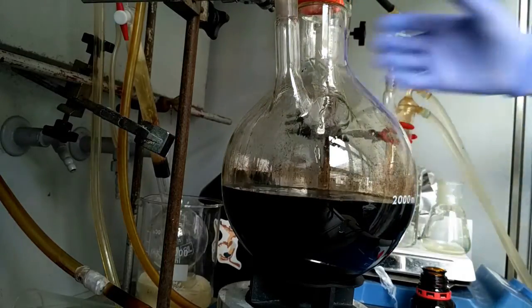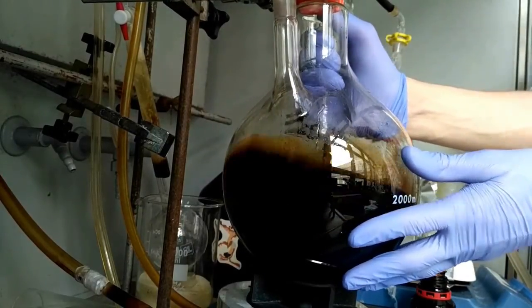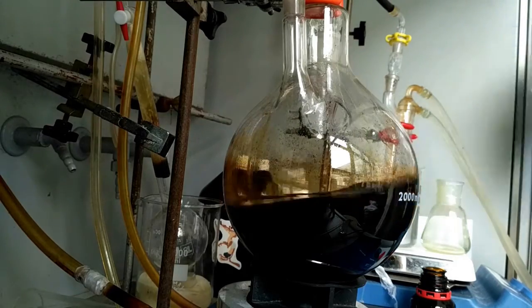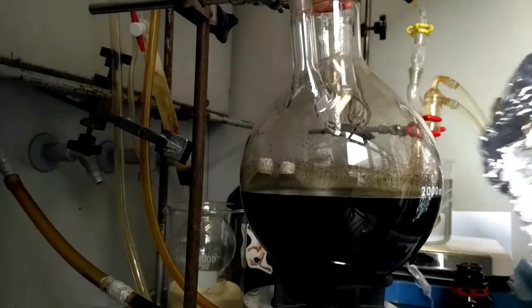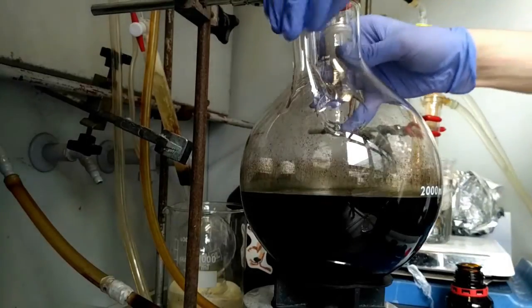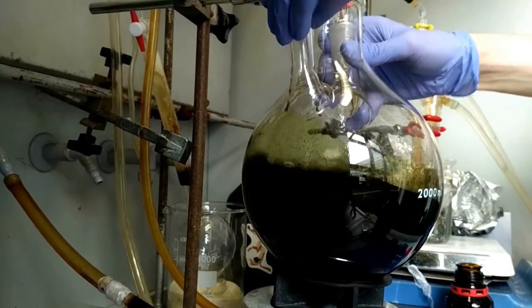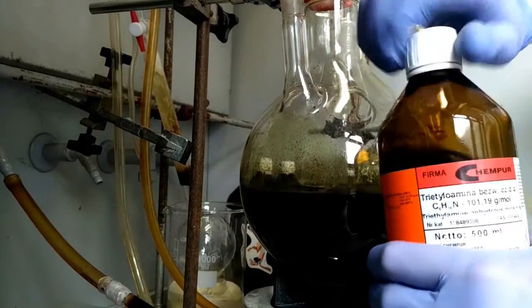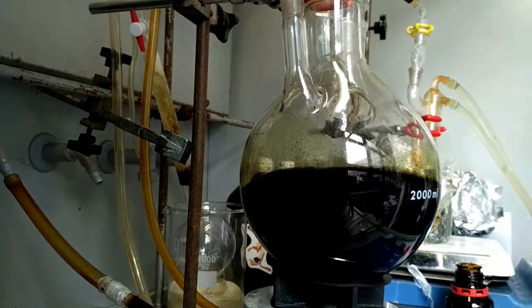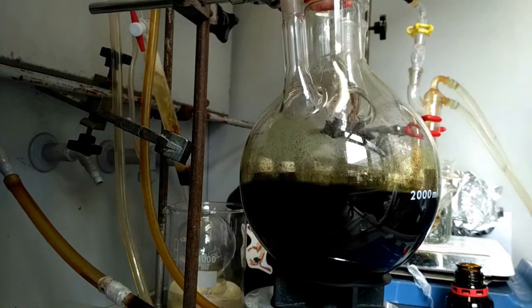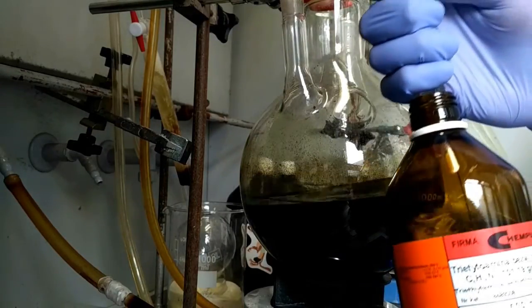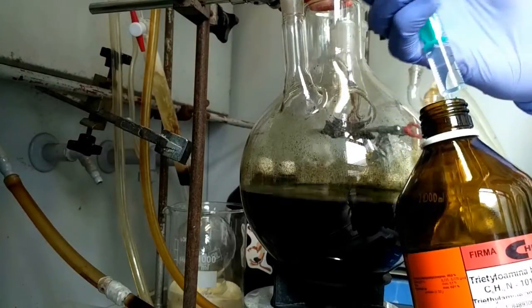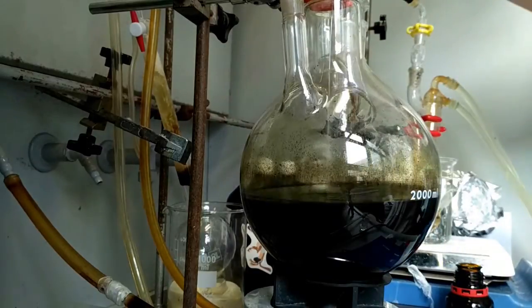You observe color change. Then after 30 minutes the acid is neutralized with triethylamine. The reaction generates fumes.